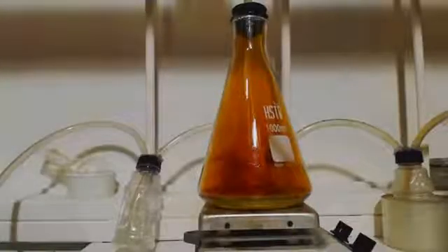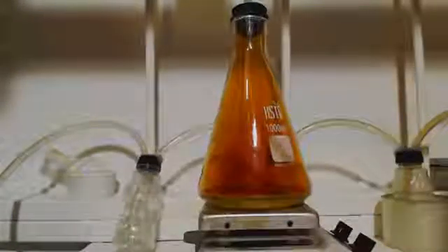All right, as you know, I put another bar in, and it's still boiling. I don't know if you can see. Everything's starting to clear up. You can almost see through the bottle, and the first bottle is right there. Look at that second bottle. That second bottle's already cleared up. The third bottle. And the fourth bottle is always clear. Look at that, right after the second bottle, which has the first wash. See how nice and clean it is? That's an empty bottle. So this has the sodium hydroxide, and then look when it comes out of there, it's all clear.